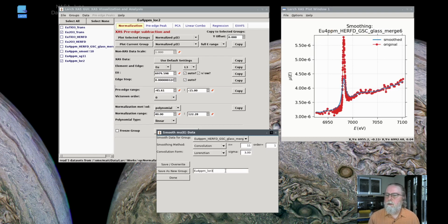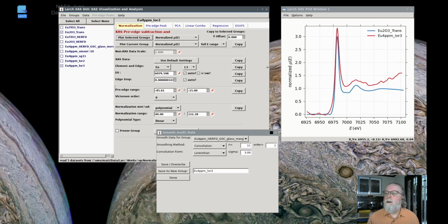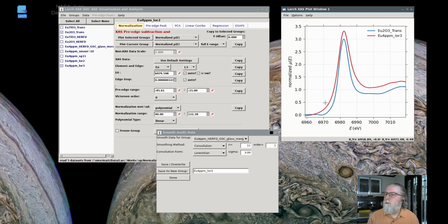That's now Lorentzian 3. I'll save that, and look at those two together. That's getting, again, close, but still not perfect. You can continue doing that, and you can see that we've sort of over-broadened the raw data, so that it's actually wider in width of the main peak than the transmission data. So we over-broadened it by convolving it with a Lorentzian of 3 eV.